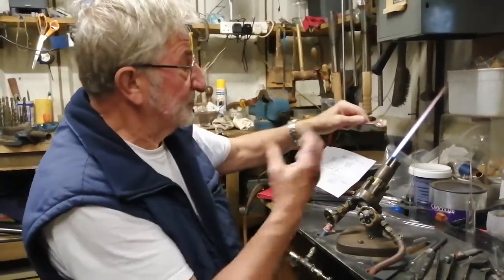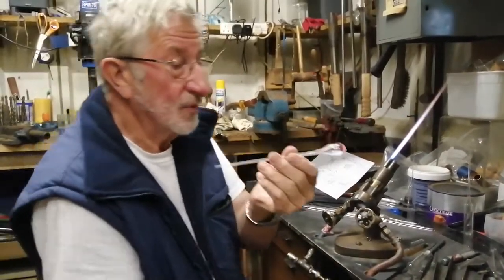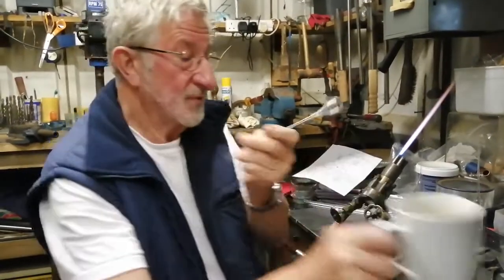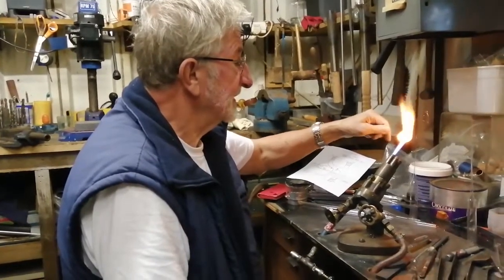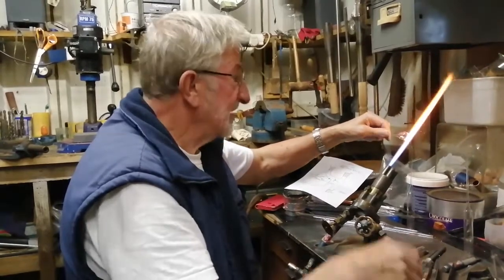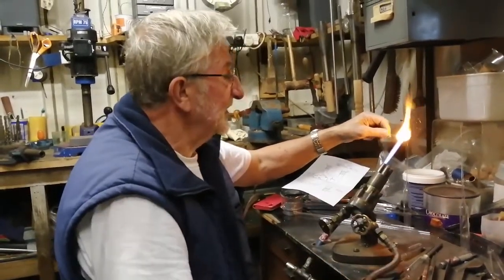The blowing makes it swell just like a balloon and thins the wall. So we've got a nice wall. Don't know if you can see that easily or not. Might see it better with a white background. So the next stage is a slightly softer flame, heating the body, keeping the flame away from this part back here because that's thin and it'll flop over.